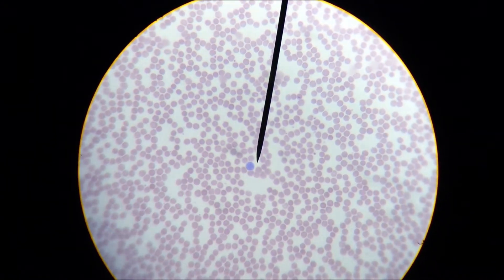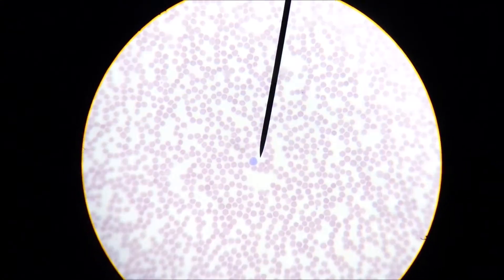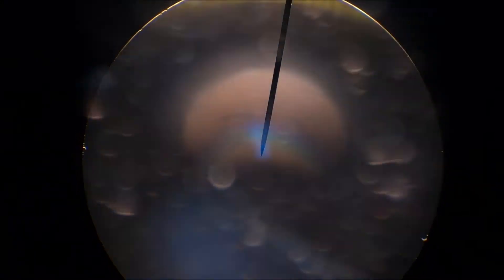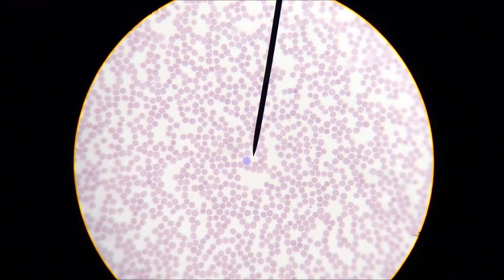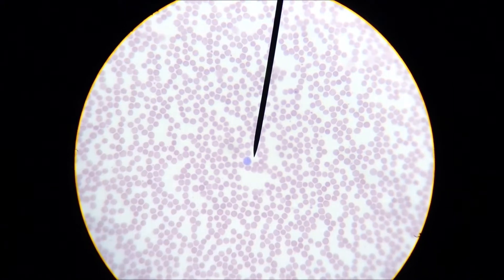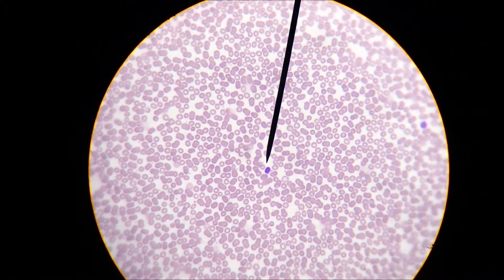That looks like a basophil, which is hard to find — I was trying to find a few good ones to show you. My camera is acting crazy but that's okay. It's a nice basophil. I just want to give you an idea of what we're dealing with: a sea of red blood cells and then one lonely basophil.